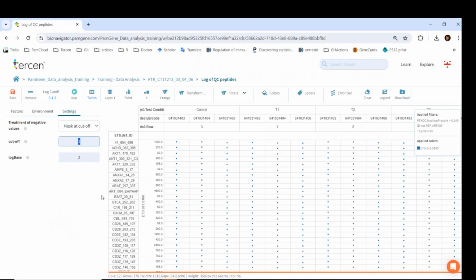This means that the operator assigns the value of the cutoff, 1, to the input S100 values which are below 1. In this way, all S100 values below 1 will have log transformed result values of 0. Additionally, there is a third parameter, log base, which is 2 by default. Let's also take a look at the filters.